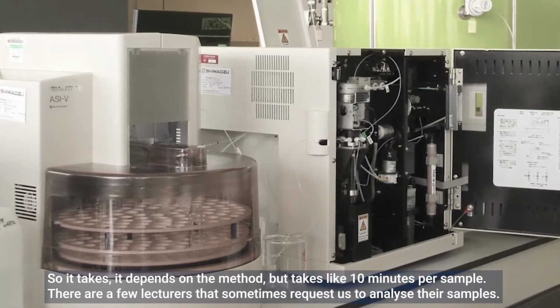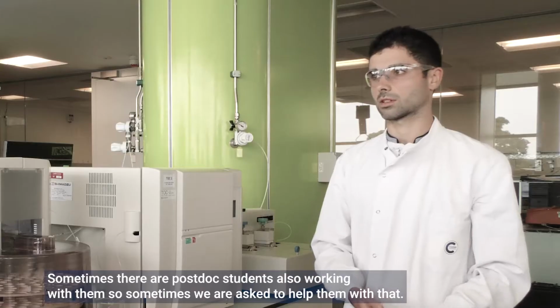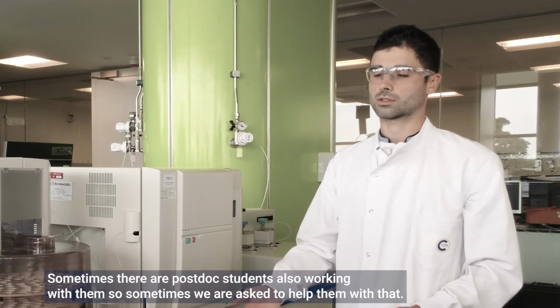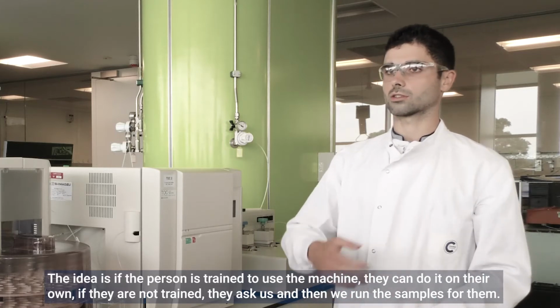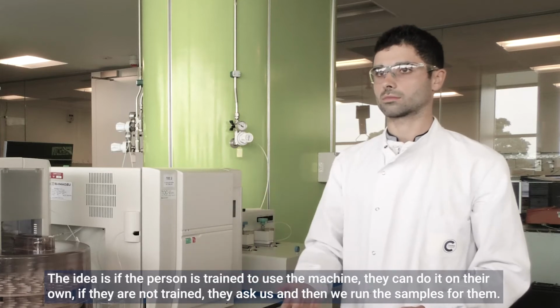There are a few lecturers who sometimes request us to analyze their samples, and sometimes they have postdoc students working with them, so sometimes we are asked to help them with that. The idea is that if the person is trained to use the machine, they can do it on their own. If they are not trained, they ask us, and then we run the samples for them.